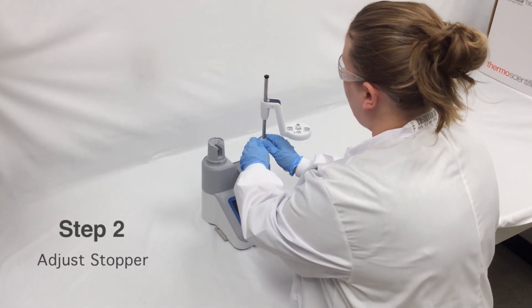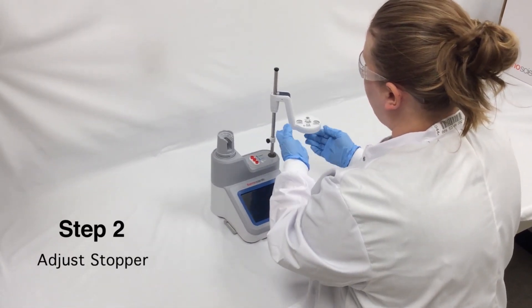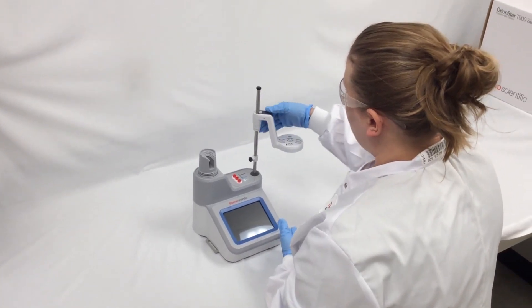Next, adjust the stopper. This prevents the electrode head from going down too far and possibly damaging the electrode.